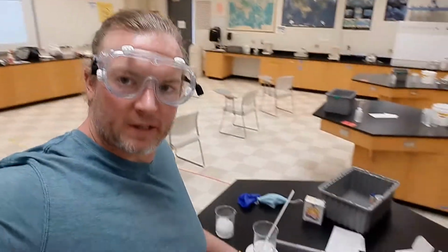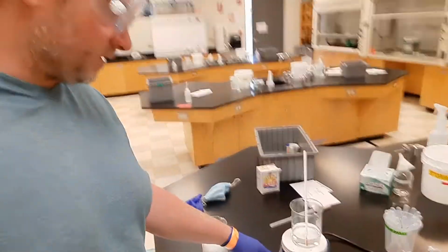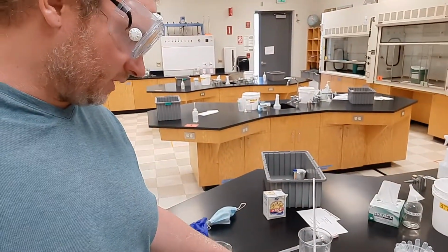I'm going to go over quickly how to set up your reaction for the Ester Synthesis lab. Now, the first thing I want you to note is that the first thing you need to get ready is your hot water, because whenever you need hot water, it will take forever to heat up.